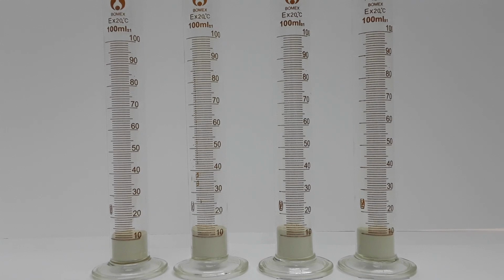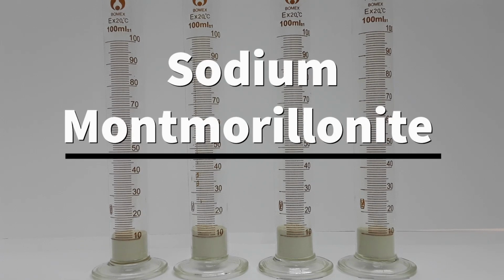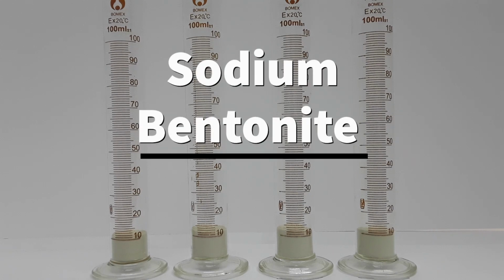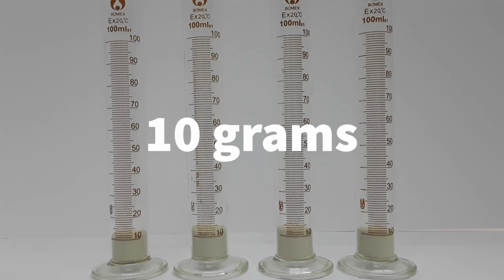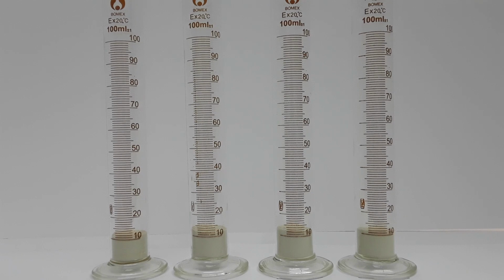in sandstone reservoirs, sodium montmorillonite, or sodium bentonite clay. Sodium bentonite clay can absorb many times its weight in water and swell up to 10 times its volume. We will begin by putting 10 grams of sodium bentonite clay into 4 graduated cylinders. We see that this occupies roughly 12 milliliters of volume.